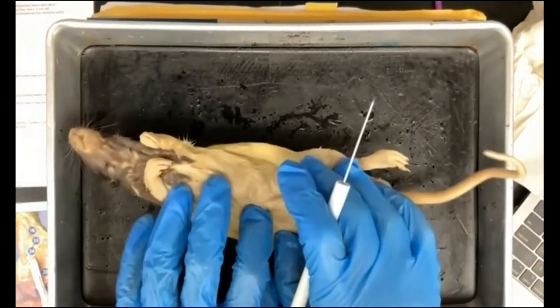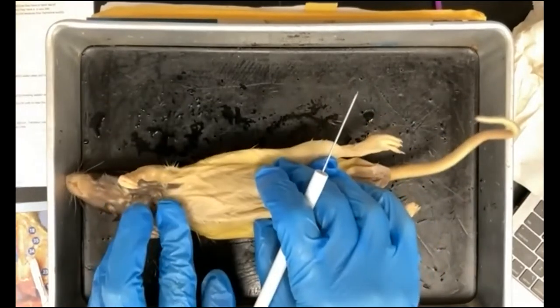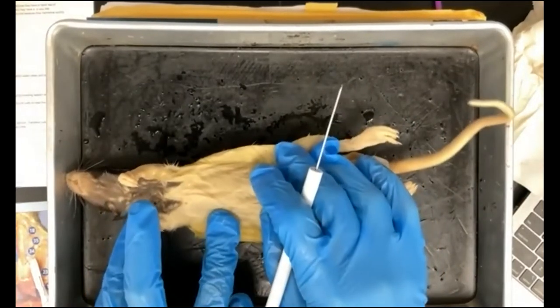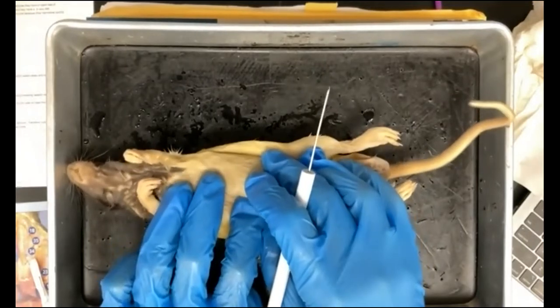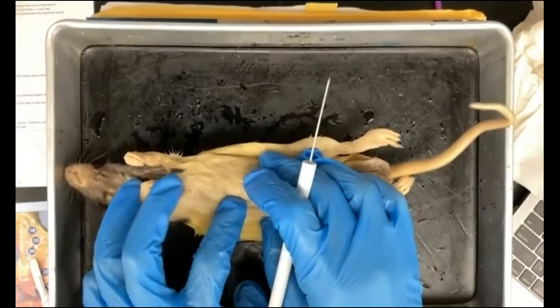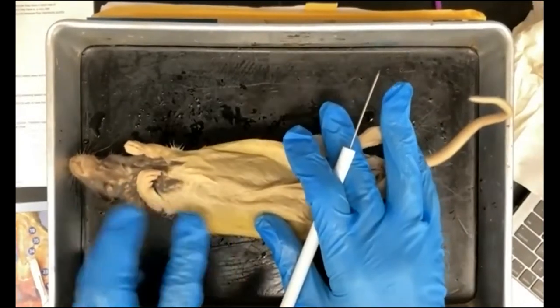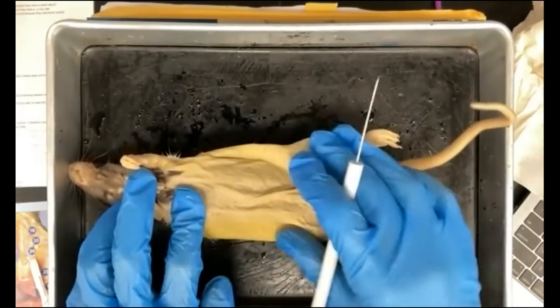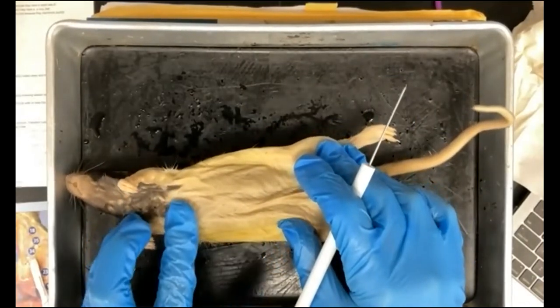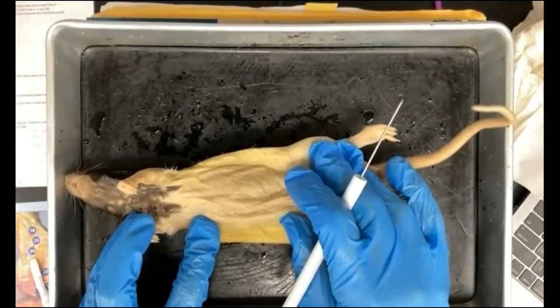There are rats in your dissecting tray on their backs. They are part of the rodent family. These are mammals, and this includes things like squirrels and chipmunks. They are the most successful group of mammals, in that they outnumber all other mammals combined. This is because they have a very rapid rate of reproduction, they adapt very quickly to changing conditions, and they have a very varied diet.